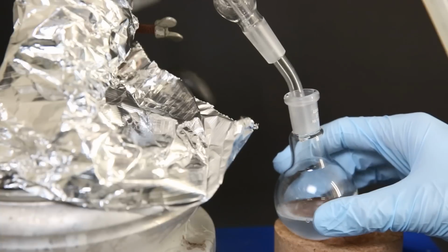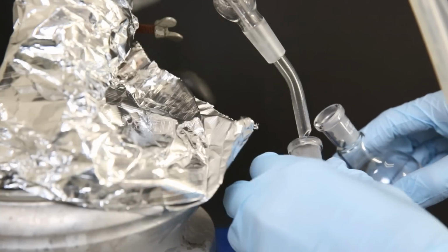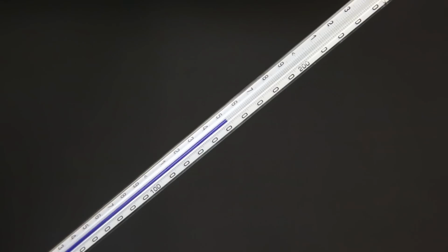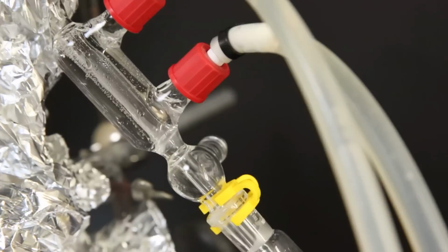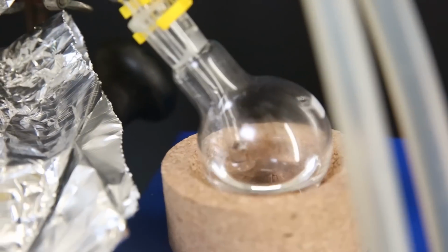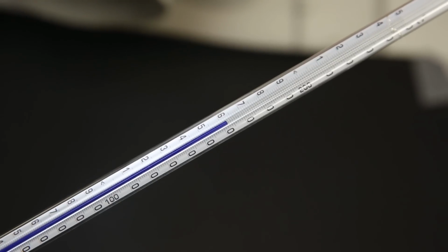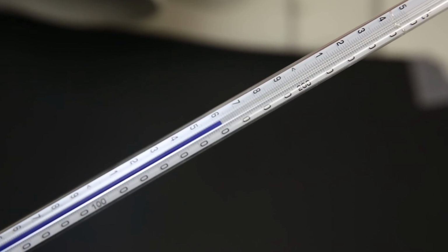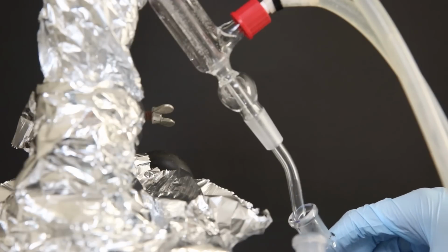I keep collecting more and swapping the flasks until I reach the boiling point of my product, which is 163 C. The boiling point of cyclohexanone is 156, which we are starting to see coming over now. After a while, I was relieved to see the temperature reach 163, and I swapped the flask to collect the 2-methyl cyclohexanone.